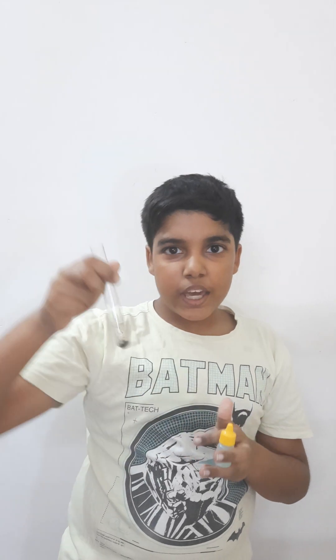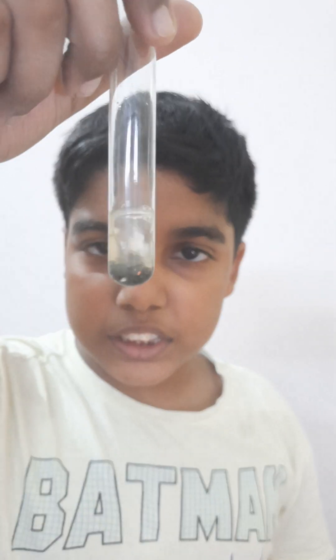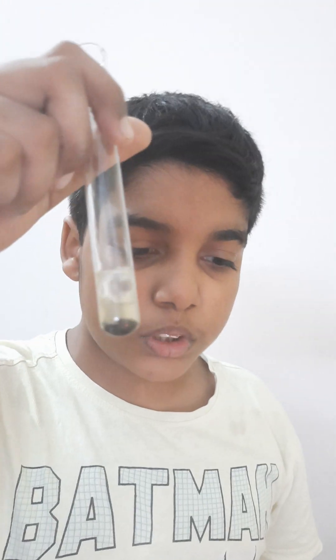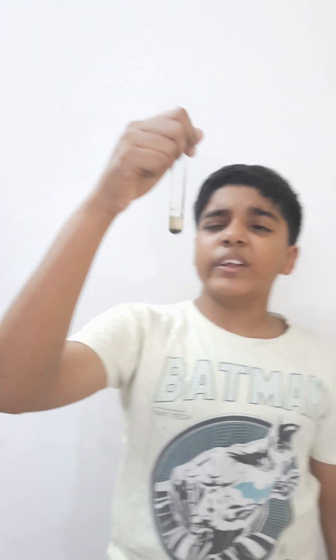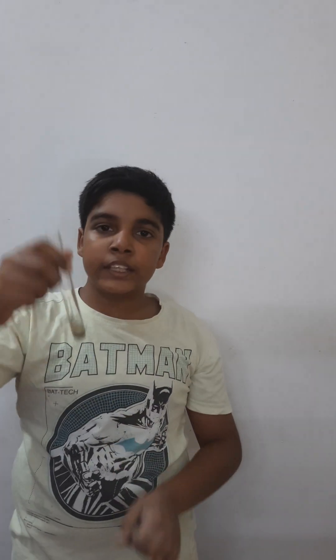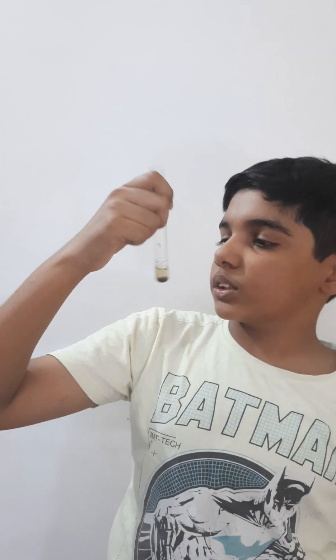When we mix copper sulfate with iron, it forms iron sulfate and copper. You can see it has turned a little bit green, which shows that iron sulfate has formed. This is the formation of iron sulfate from copper sulfate due to the reaction with iron. This topic is taught in 7th grade but also has great importance in class 9th and 10th.